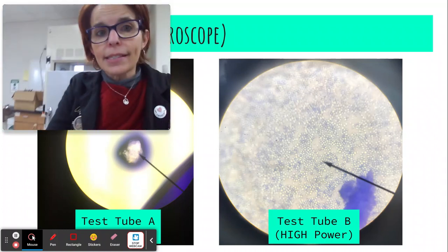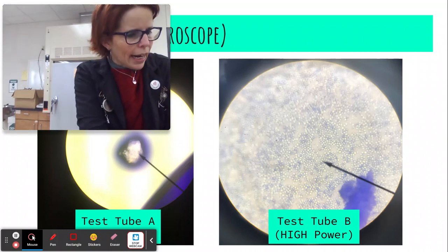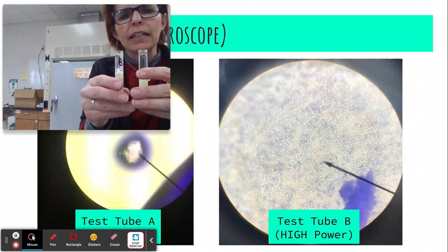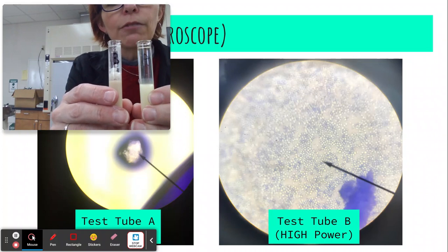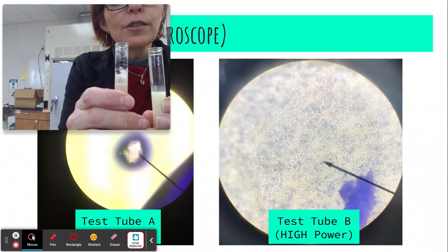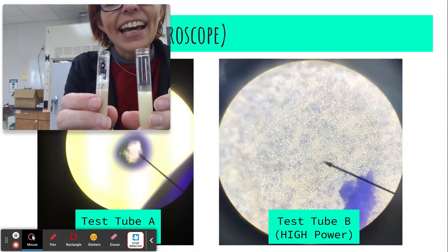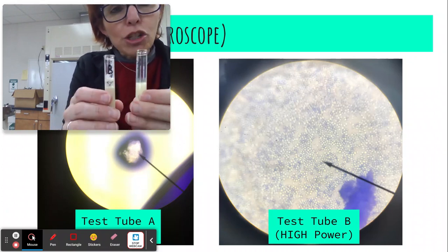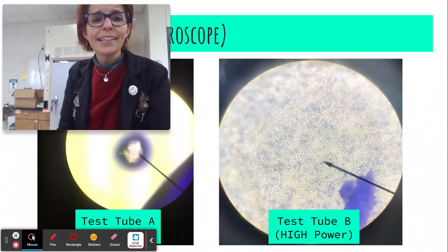Now let's take a look and see. Oops, I almost knocked things over. Let's see how our DNA experiment turned out. I'm going to hold them up and see if we can get the camera to be able to see the difference. So if there's anything floating inside of it, it's DNA. If there's nothing floating inside of it, then there's no DNA. And I hope that you can tell that B is full of stuff floating in it, and that's DNA. A has nothing floating in it. It's completely empty in the top because there's no DNA. So now we have two pieces of evidence that B is alive. It has cells, it has DNA.